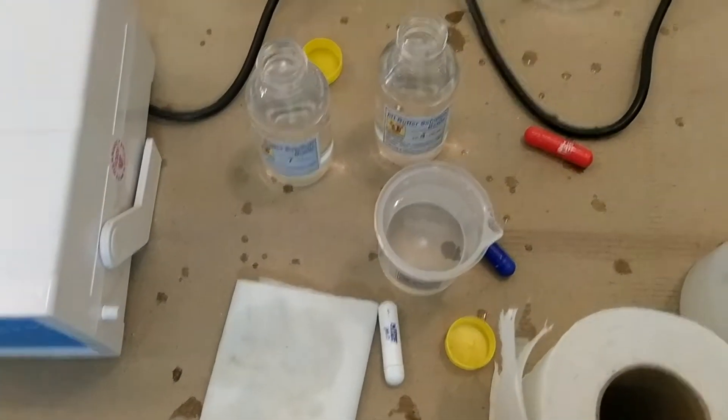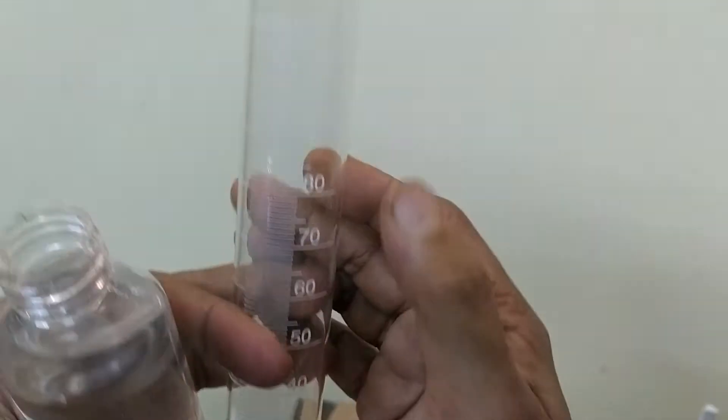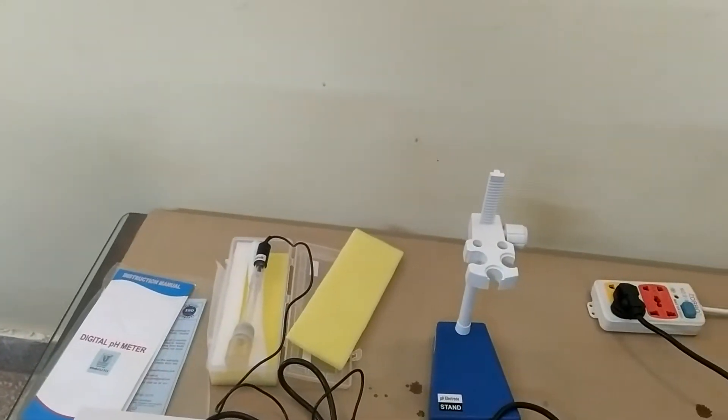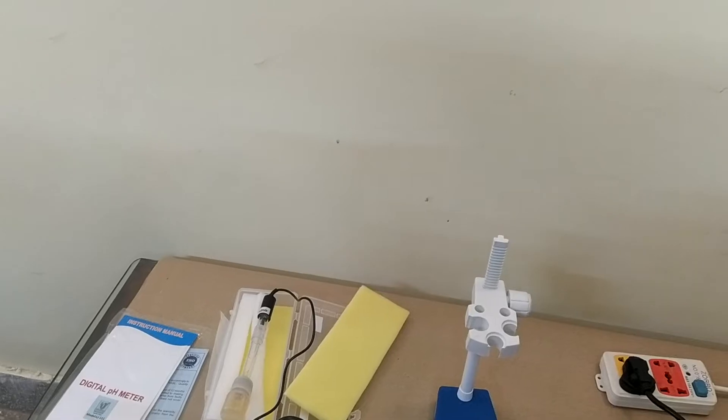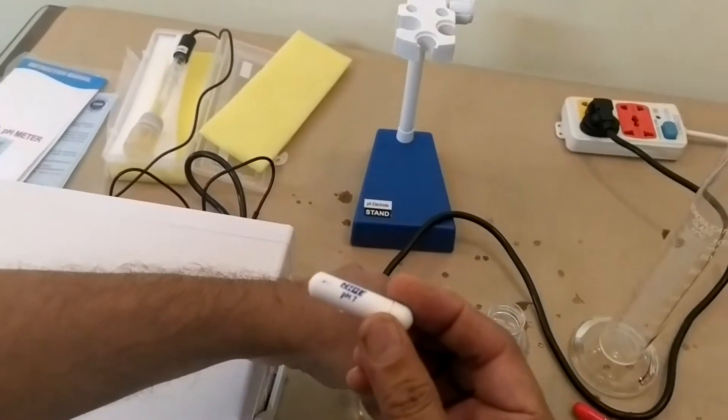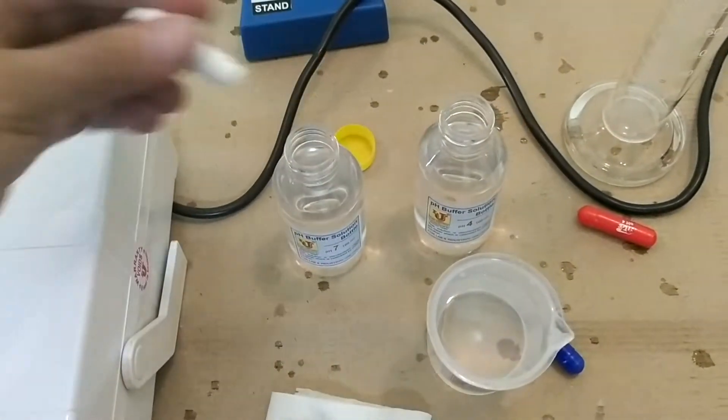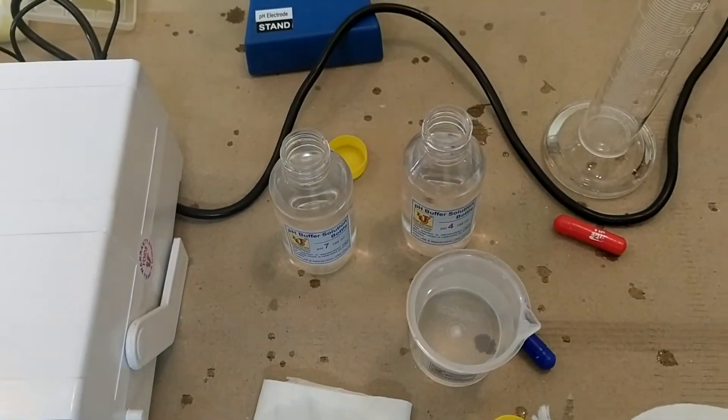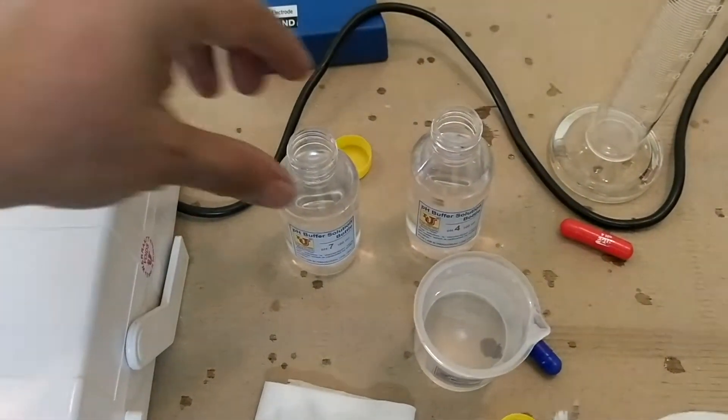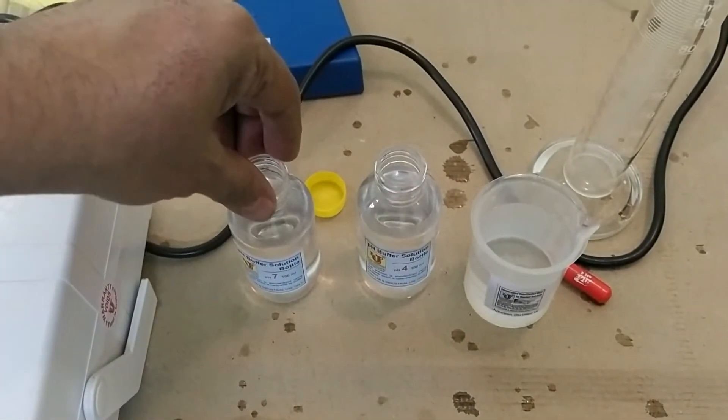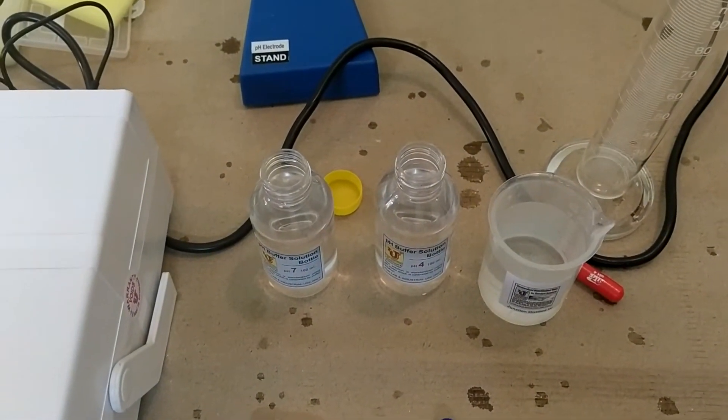How to maintain this standard solution? Take 100 ml distilled water and add to this bottle. Take this pH buffer capsule, open and put all the salt in that. Give standby to 4 hours. Your standard buffers make uniform and homogeneous. Then these are ready for use.